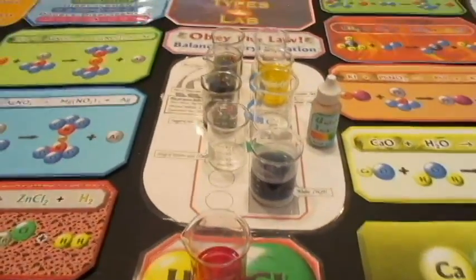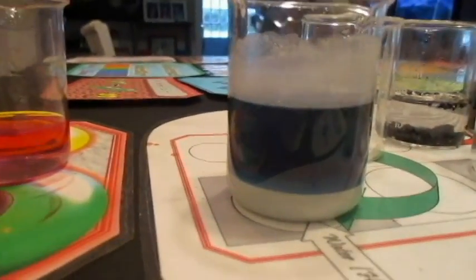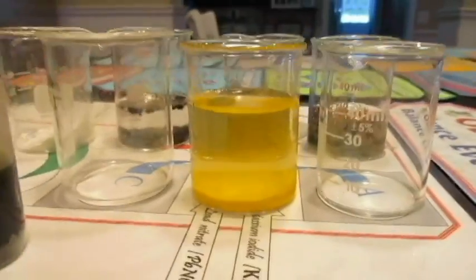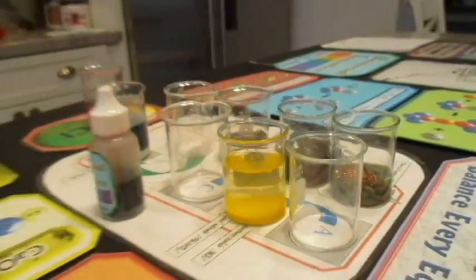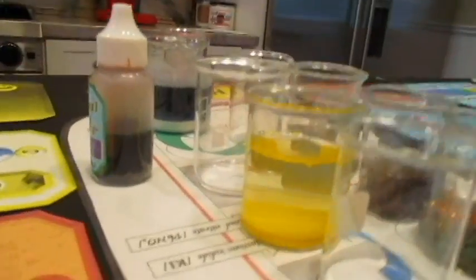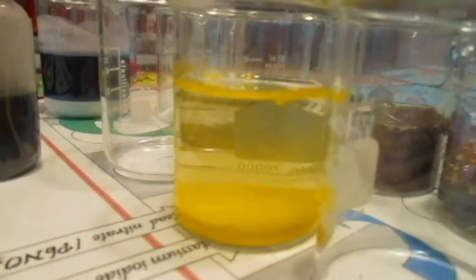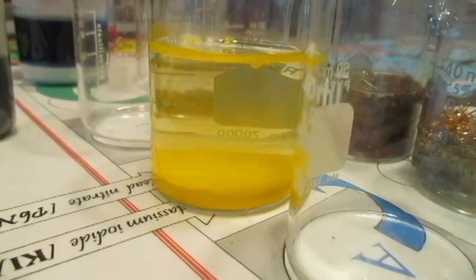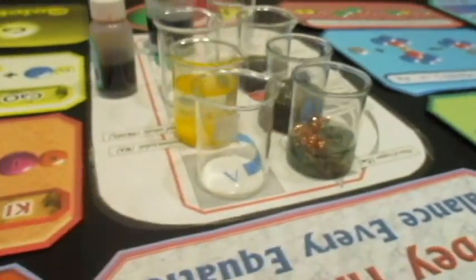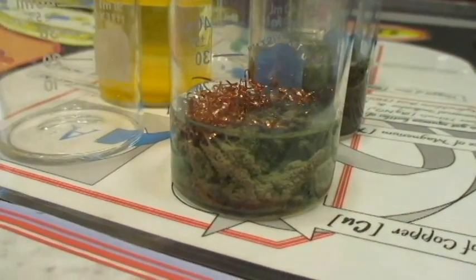So now that we've waited about a half hour, let's take a look. Okay, that looks about the same. What about, oh, wait a second, look. Look at that. It's really, really settled out. So remember, some things appear to be liquid, but they're not. If the solid eventually settles at the bottom, that was not a solution. And that is what we call a precipitate. Precipitate actually means to throw down. Like when it's raining, the clouds are throwing down water on you.